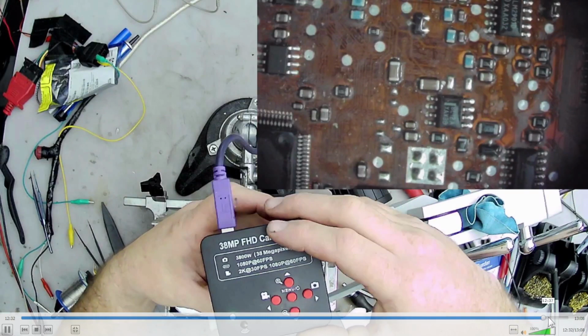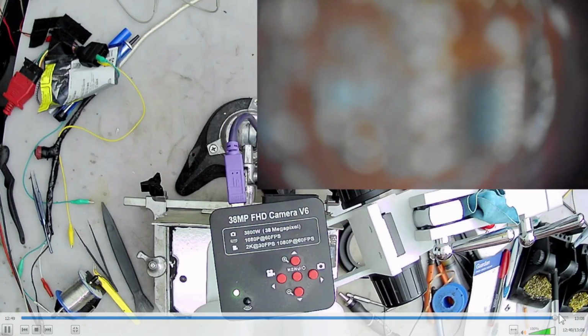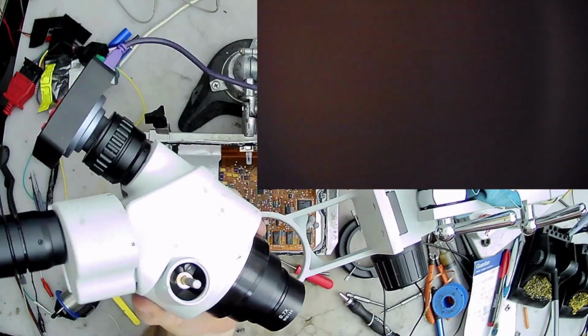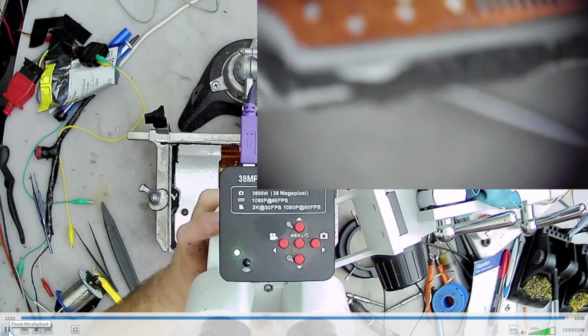It's acceptable for me. So I went ahead with it and put everything back together, put my screws back in, checked both my lenses, everything was good. So really simple. If your camera port's spinning like that, or you need to get inside of this thing, it's no big deal. It's a very simple thing to do, so don't be afraid to do it.